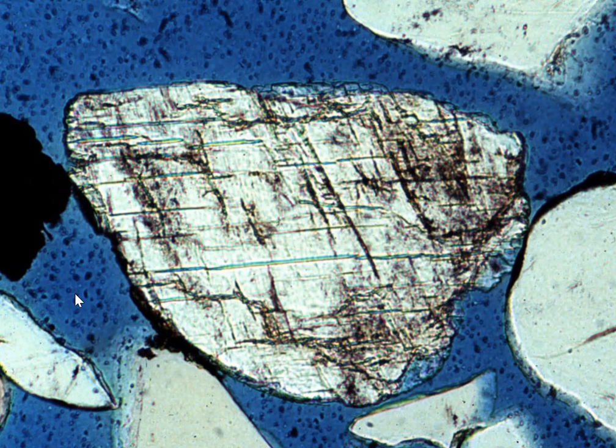Now, in this case, they may or may not have used the electron microscope, but what I'd like to point out to you is that even though this grain has a pretty clear, similar color in PPL, and so does this grain, notice how some of these grains are really rounded and pretty clear in the middle. Oftentimes that's going to turn out to be quartz. Hopefully you guessed quartz.